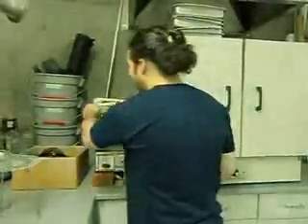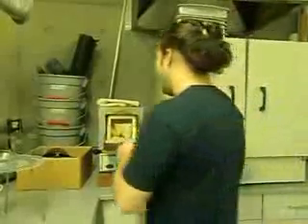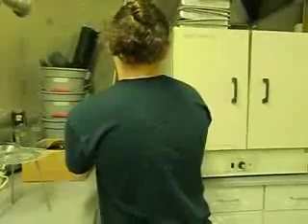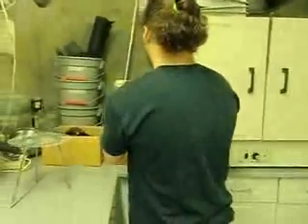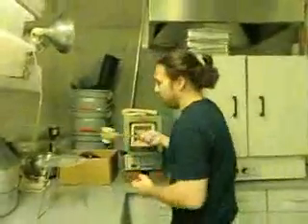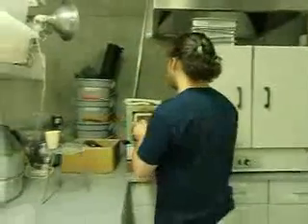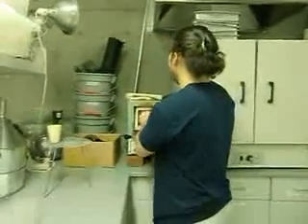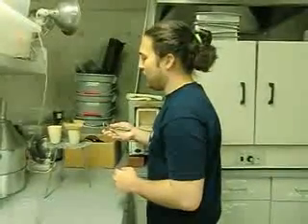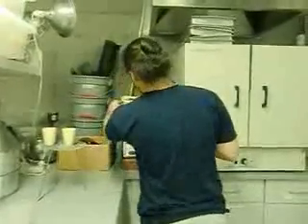Alright, so now that we're done, we're going to take these things out. Let it sit for like 5 hours because it's super hot. Now remember, the one on the right is our surface sample. Take it out with tongs, and make sure it's not going to burn your skin. Put it on this right here. Make sure it doesn't fall. Remember the placement of your samples. And these are just one replicate of the many we did. And let's close it back up.